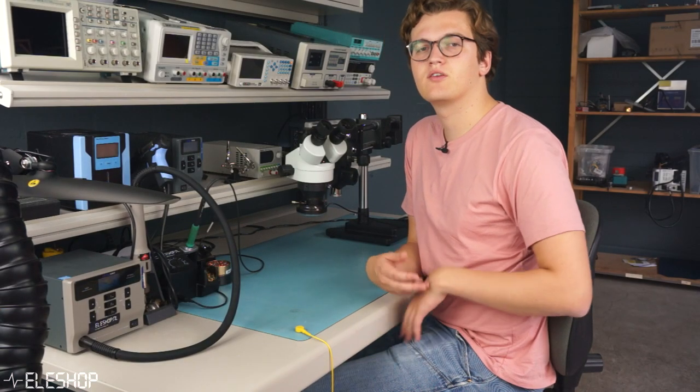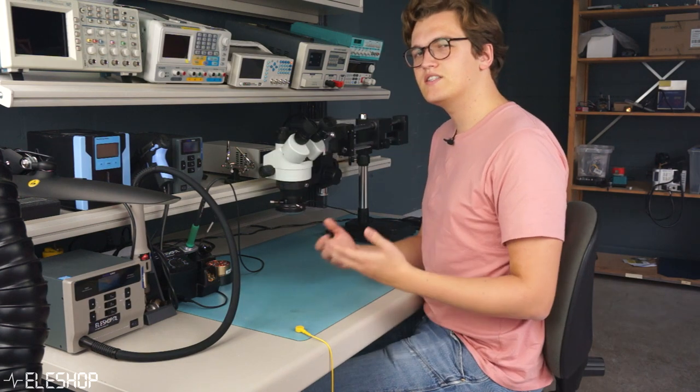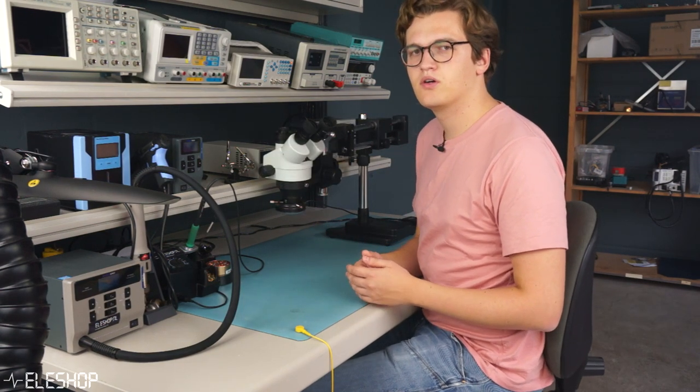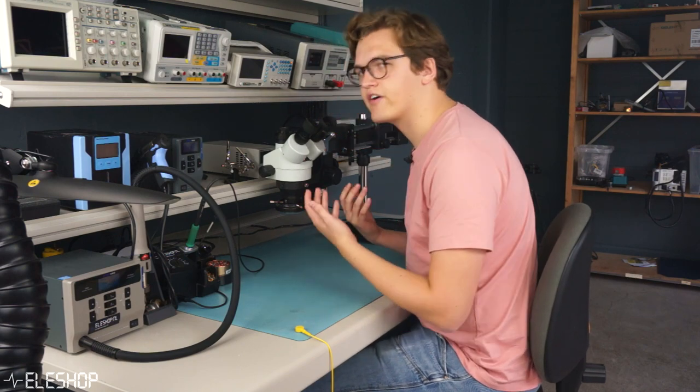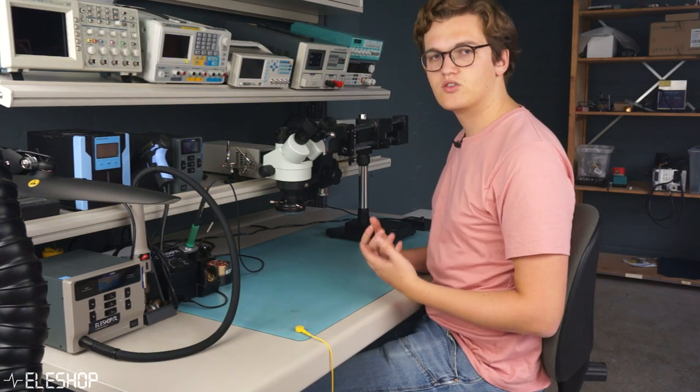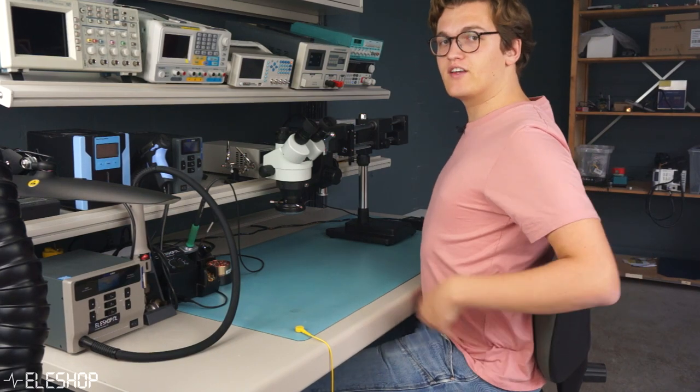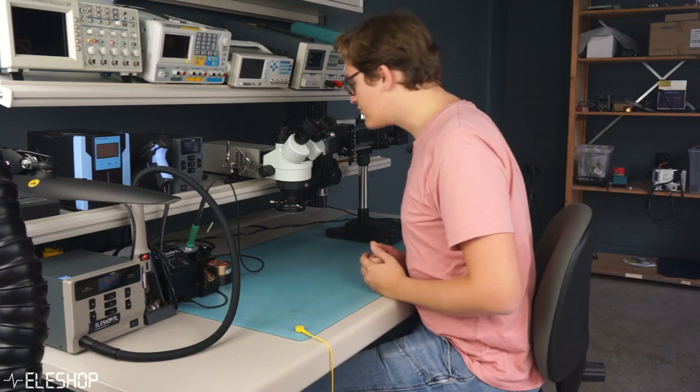First of all you have to think about the way you're sitting. Especially when you're working with a microscope you lean forward, you start to slouch, which is not very good for your posture. So try to keep your back straight and your shoulders back when you lean forward.